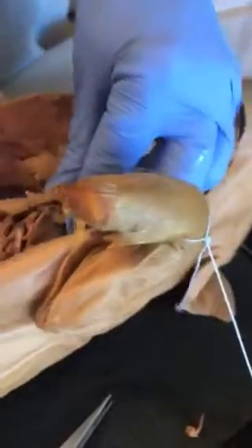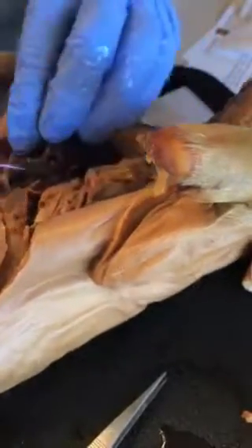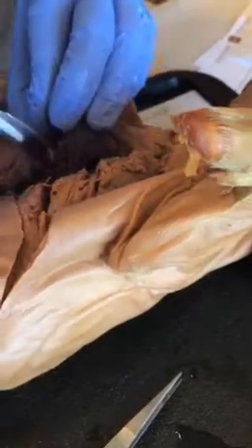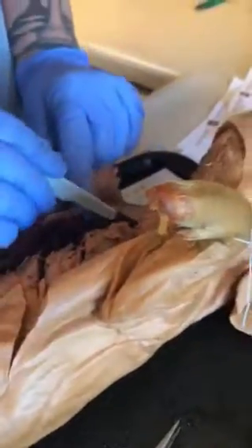Okay. So where you're cutting open right now, all the spots in between the cuts are the rib cage. This whole thing is the rib cage. So like when you're doing CPR, this is where you're pushing. So this is in between ribs. There's another rib here. Ribs, ribs, ribs. So what I'm doing basically is cutting his ribs off. Oh, and inside of all those ribs is what, his heart, his lungs? Yeah, this is what we're exposing right now, his insides.